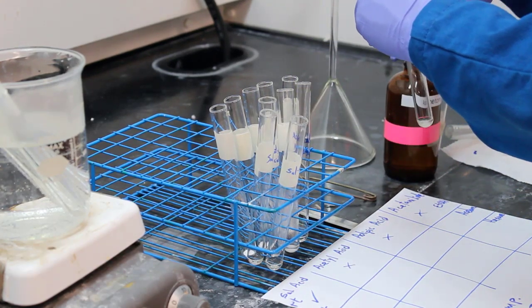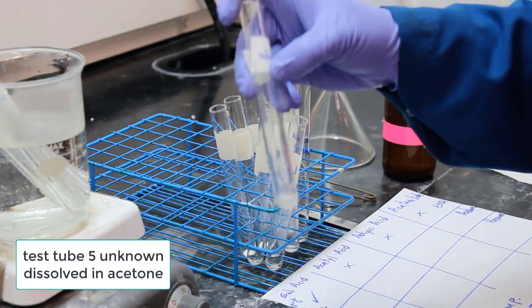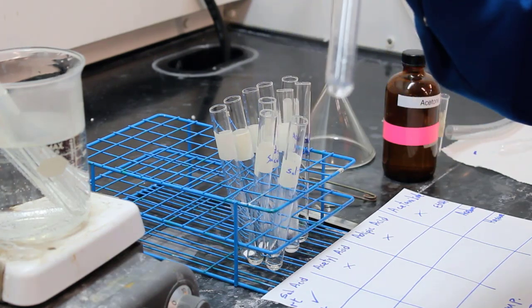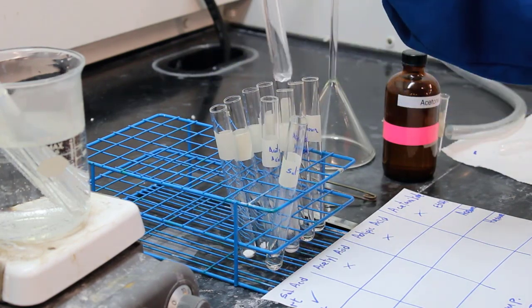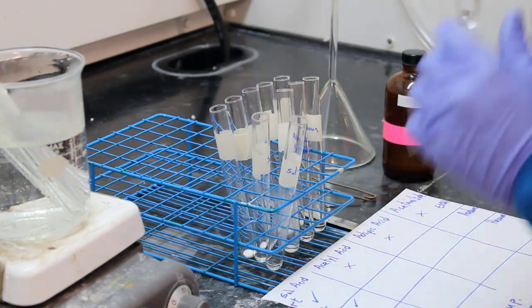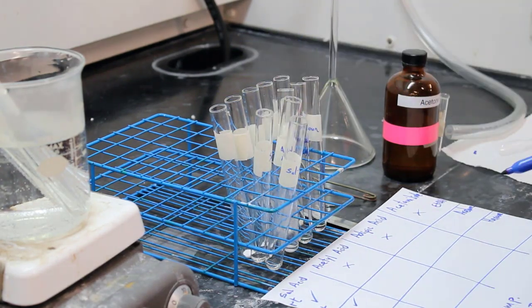Does it dissolve, my friend? And it appears, oh yeah, it definitely dissolves. All right, so salicylic acid dissolves in acetone at room temperature.